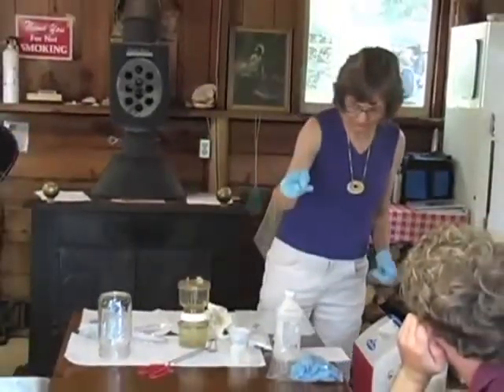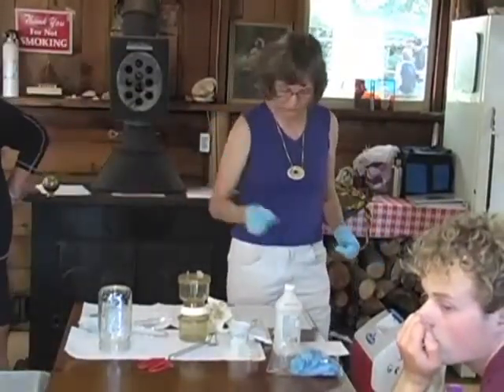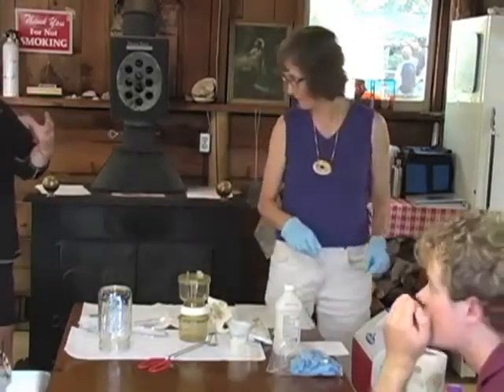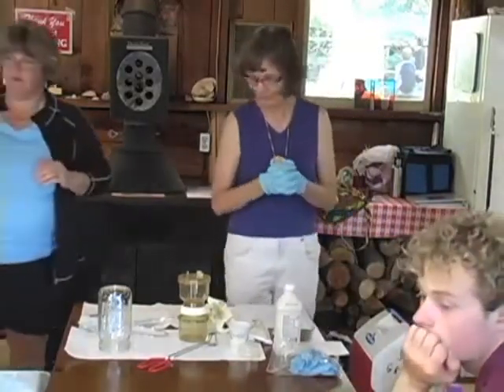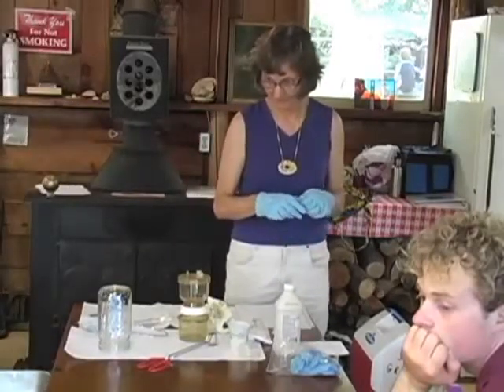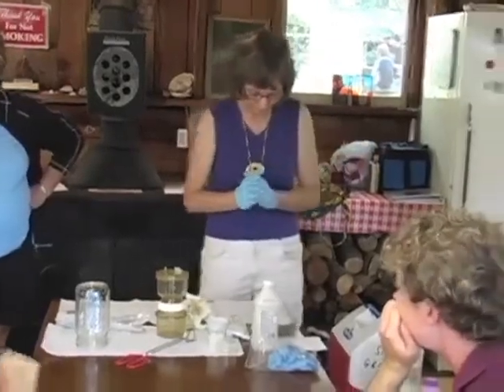The incubator's plugged in over there, and I've adjusted it once, trying to get it close to 44.5. We could check it again. Think of it like a little oven. It's a temperature-controlled oven. We don't want it too hot. We don't want it too cold. And the centigrade has a C at the top, so make sure you're looking at the right scale. Okay, David. All right.